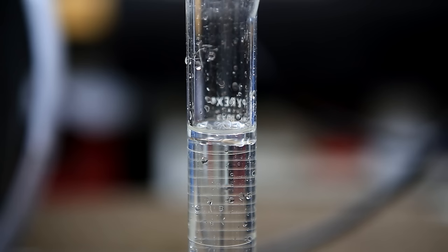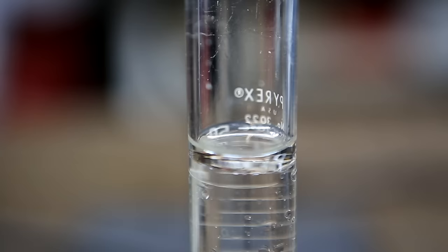A total of 50 milliliters of distillate was collected and at the top you can clearly see another layer. This upper layer was removed using a needle and a syringe.